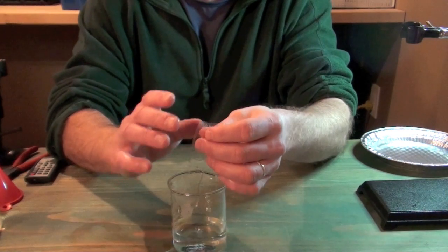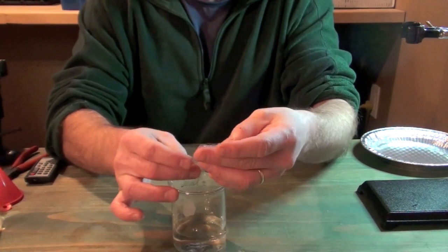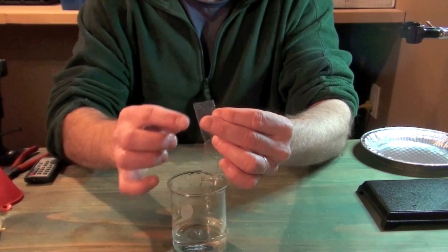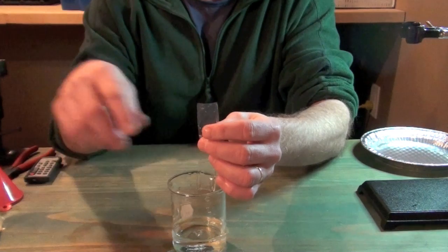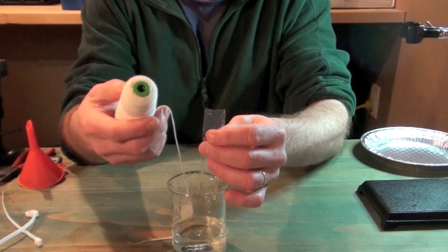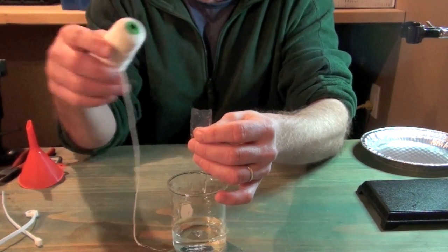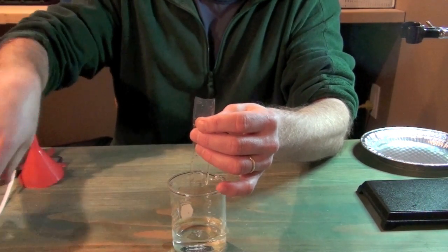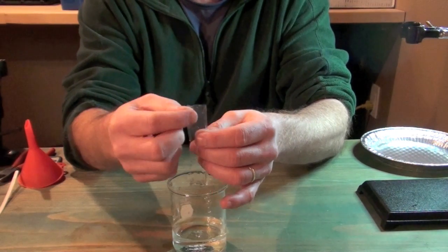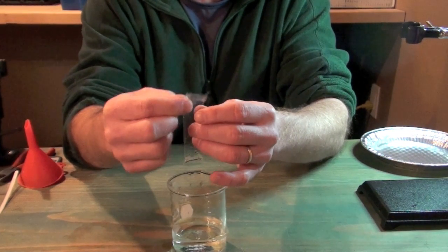to make a baggie here for an osmosis experiment, we have to tie off the ends. And what most textbooks will have you do is take this end and tie it off with good old-fashioned string. And that actually is a pain and a two-person job. And often it's kind of hard to tell how hard to pull the string in order to get a tight fit without actually tearing right through the baggie.